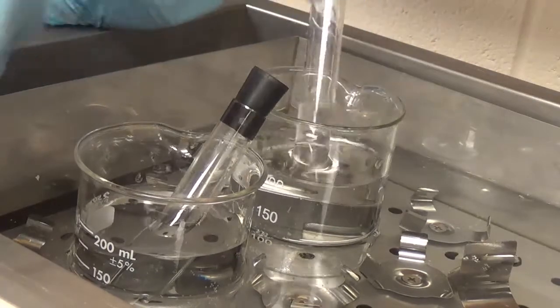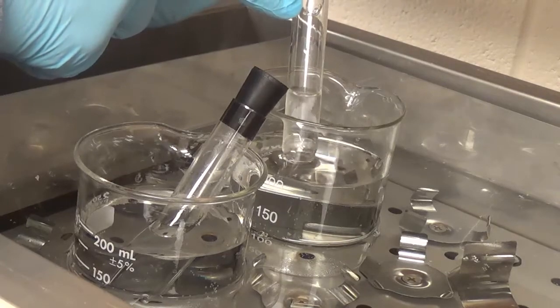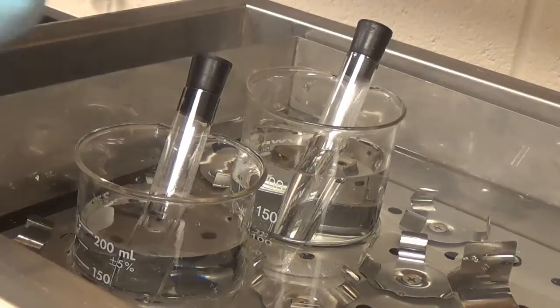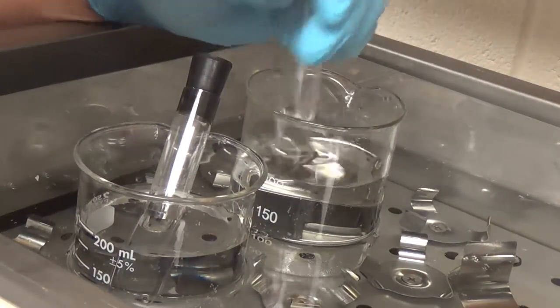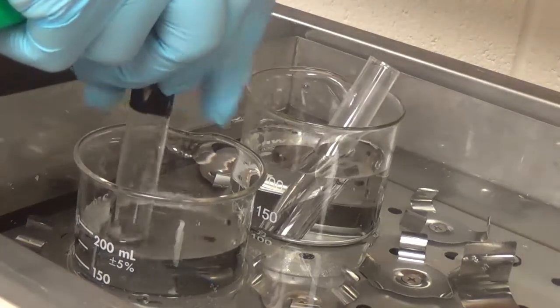And so now I'm going to take 2 mils of this. This is our K2S2O8 potassium persulfate. Add it to here. We'll do a quick shake and then record the time, this time at 35 degrees. All right, so 2 mils. I'm actually going to remove this as well.